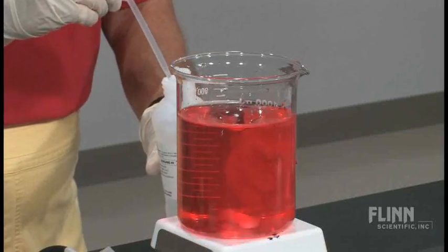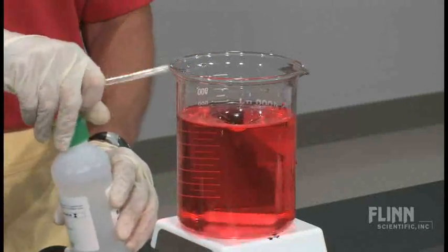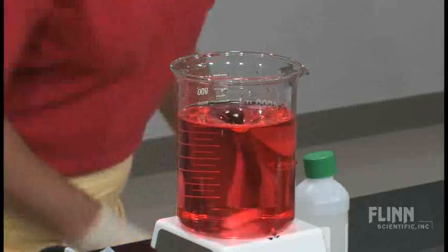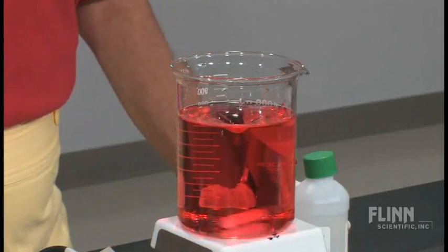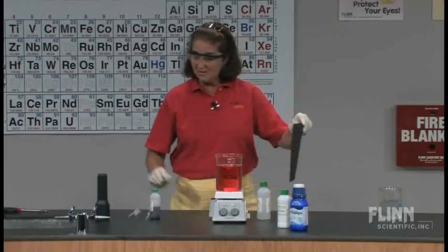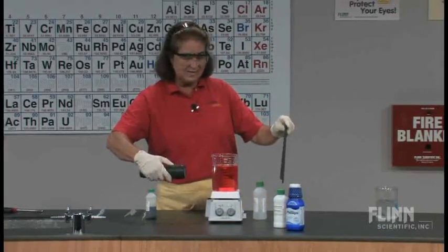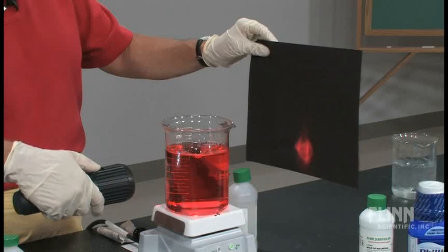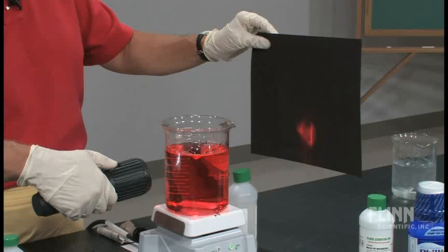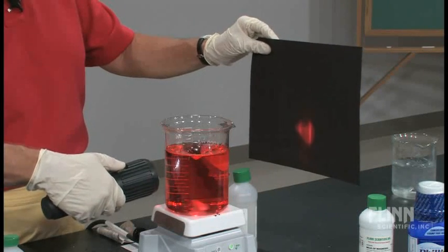Just a couple of good squirts. Do you notice something about our solution? What we have here now is a solution — it's no longer a colloidal suspension. And you can come back to the Tyndall effect again: where before the beam of light was being scattered, now, as we pass the beam of light through the solution, the particles are so small — they're dissolved, truly in solution — and the beam of light passes straight through.